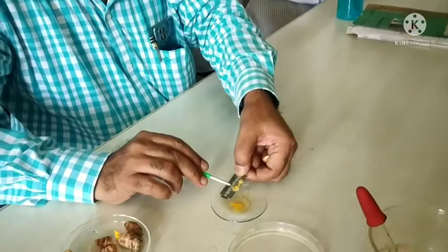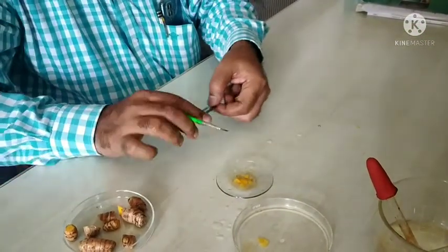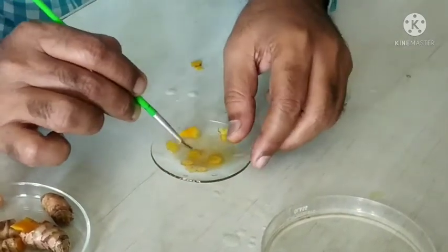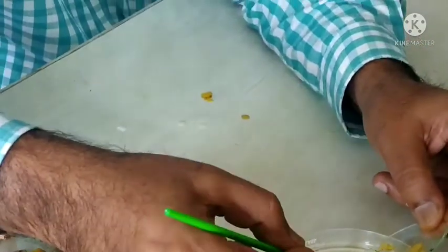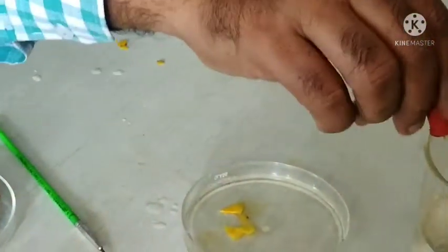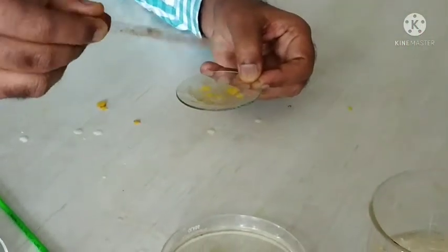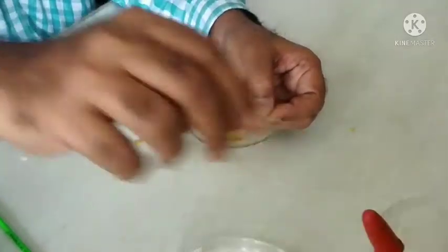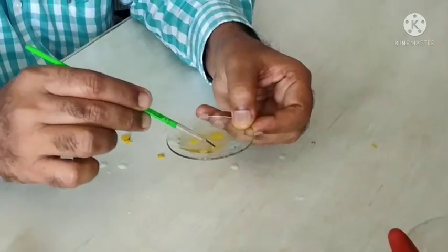With the help of a camel hair brush, transfer the section into a watch glass containing water. Select a thin transparent section and remove the damaged portions. Selected portions of the sections are washed using water as a cleaning reagent to remove debris present on the section, with the help of a camel hair brush.